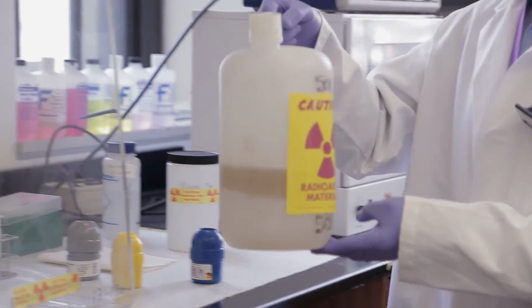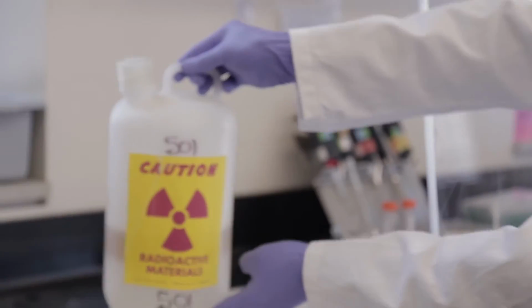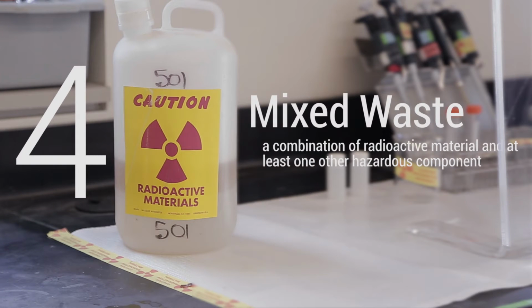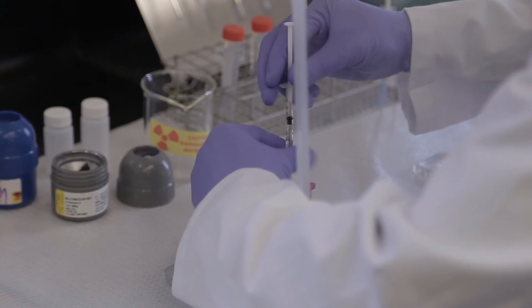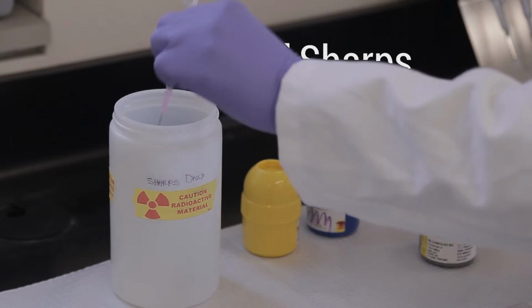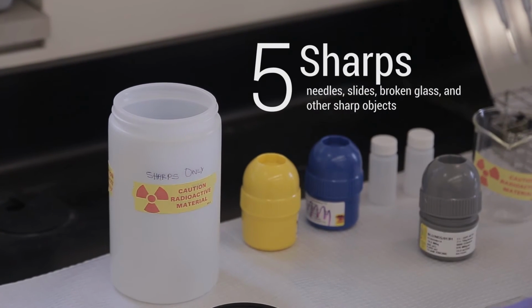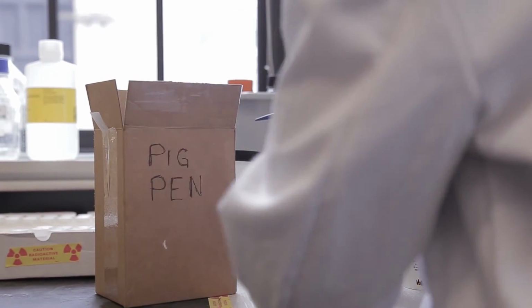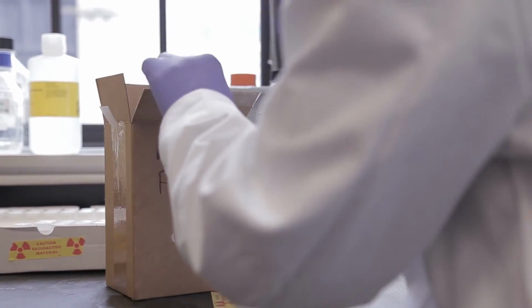Mixed waste is a combination of radioactive material and at least one other hazardous component. Avoid the generation of mixed waste with careful planning. If the generation of mixed waste is unavoidable, talk to ORS Health Physics Services about your options before beginning work. Sharps, such as needles, slides, broken glass, and other sharp objects. Remember, pigs should not be placed in any of these waste streams.